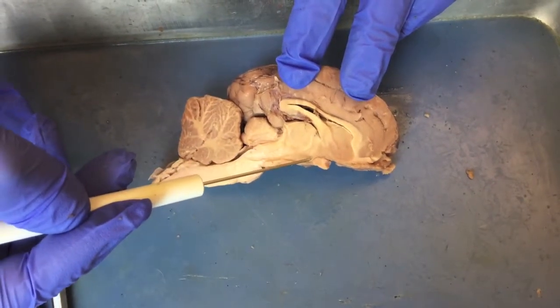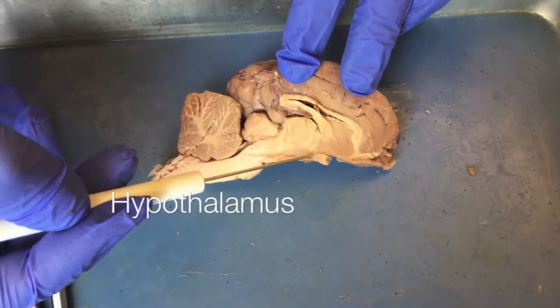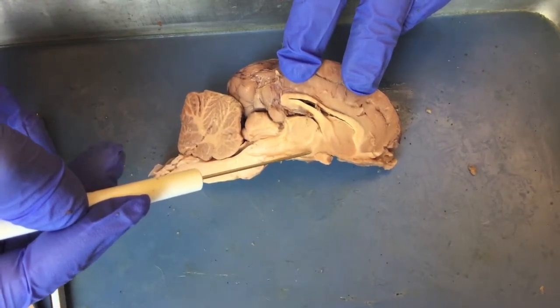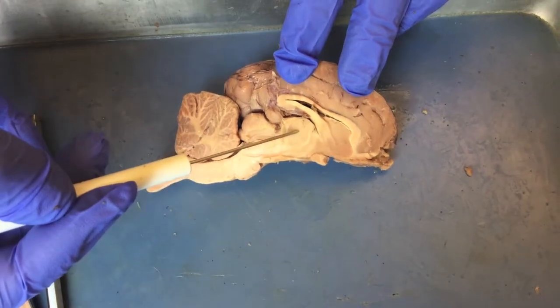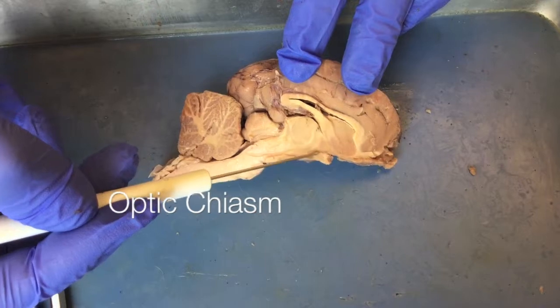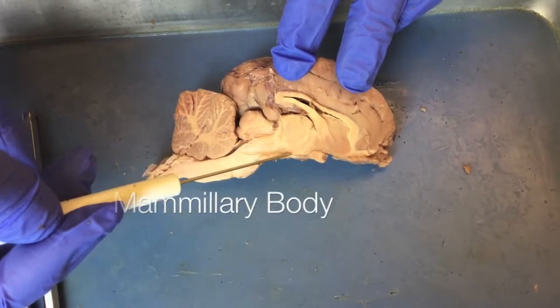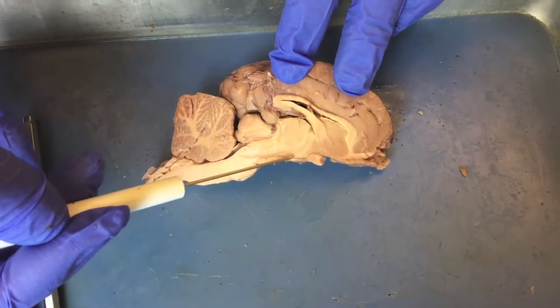Beneath the thalamus is a region called the hypothalamus. You can locate the hypothalamus because of other structures that surround it. It is inferior to the thalamus, it is superior to the optic chiasm, and slightly anterior to the mammillary body. This region is the hypothalamus.